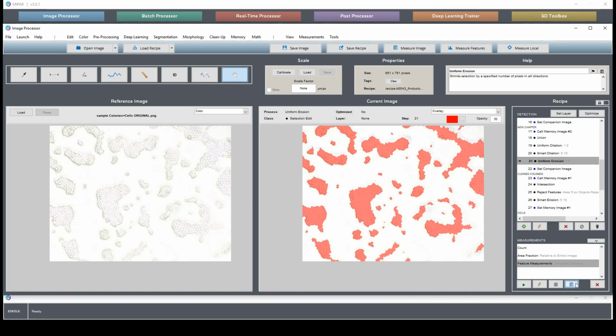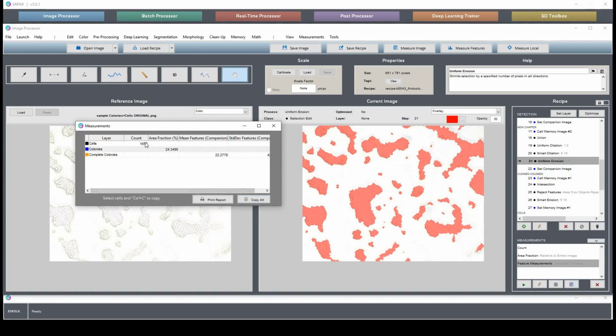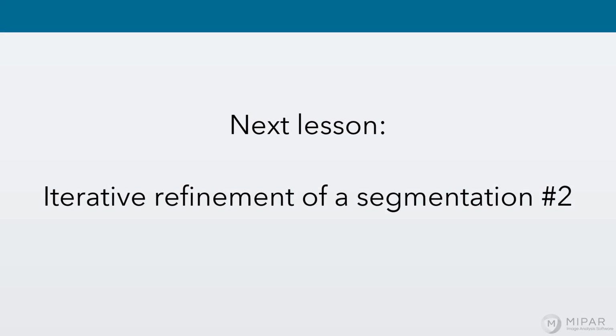And now we can do our measurements, and we have about 100 fewer cells. So that actually ended up being kind of significant. And that's it for today. Next time, we'll continue with iterative refinement of a segmentation.